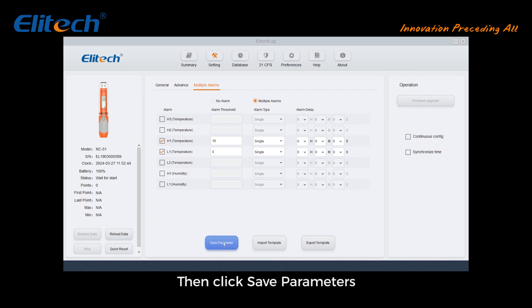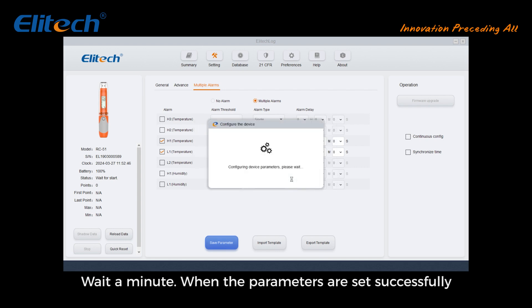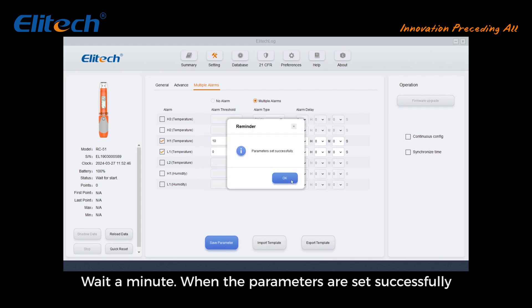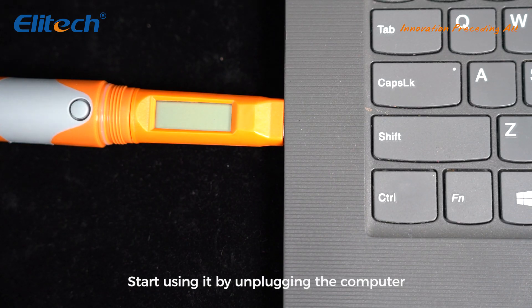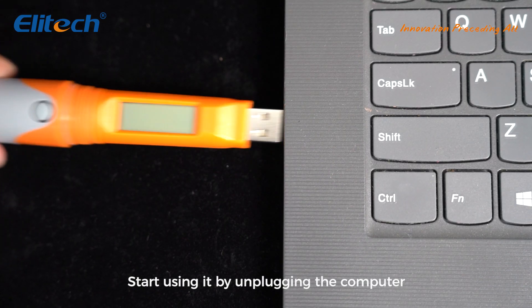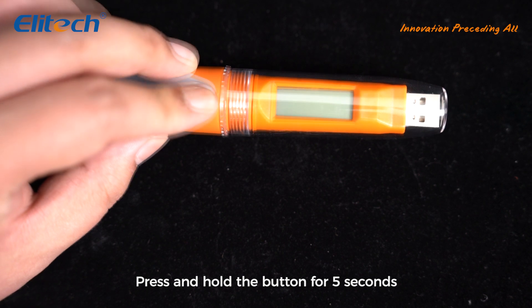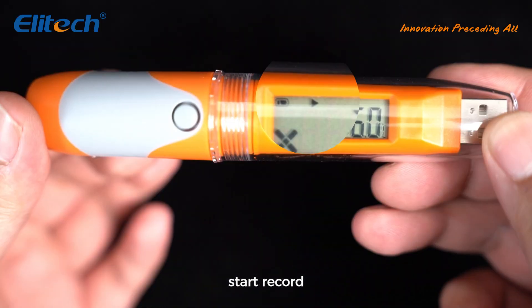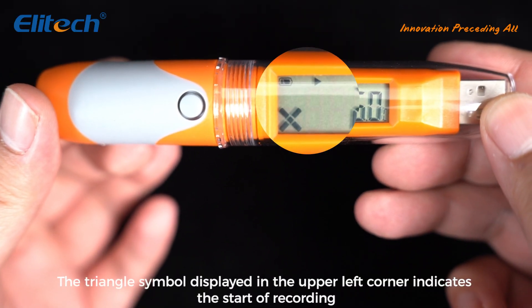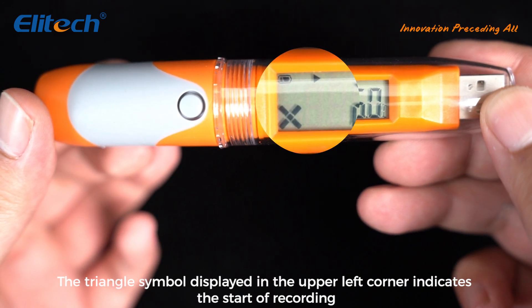Click Save Parameters and wait a moment. When the parameters are set successfully, click OK. To start using the device, unplug it from the computer and press and hold the button for five seconds to start recording. The triangle symbol displayed in the upper left corner indicates that recording has started.